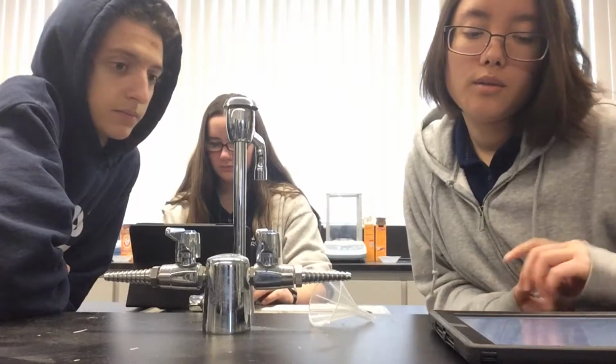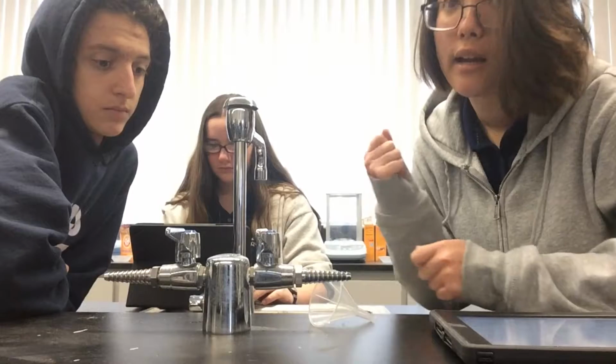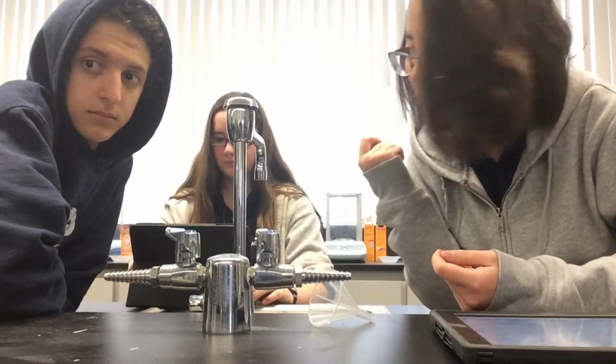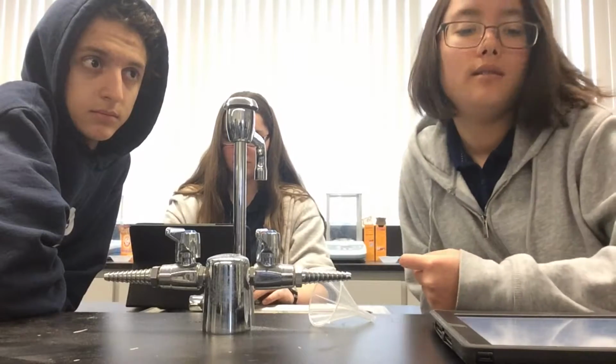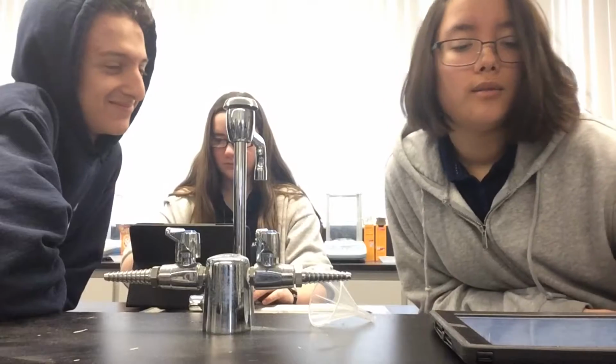And then also, some of the gas could have escaped from the balloon while we were taking it off of the Erlenmeyer flask. I don't know why I said mask. Sorry. So, yeah.